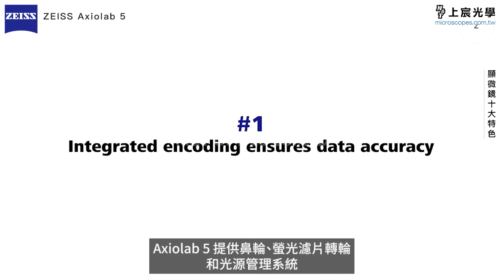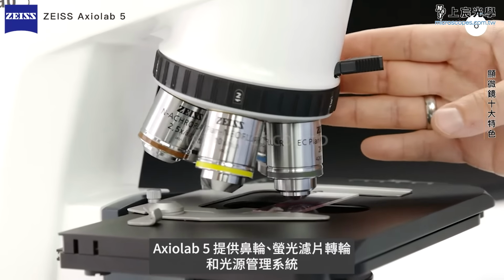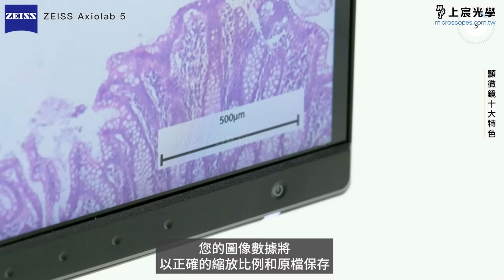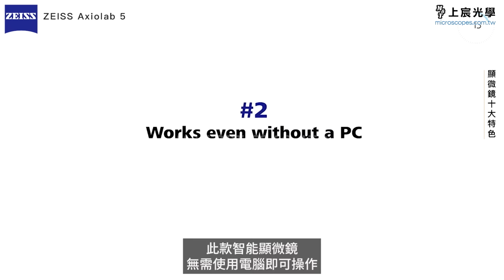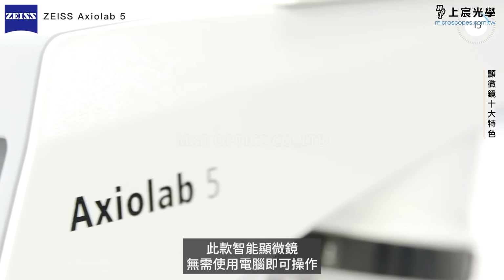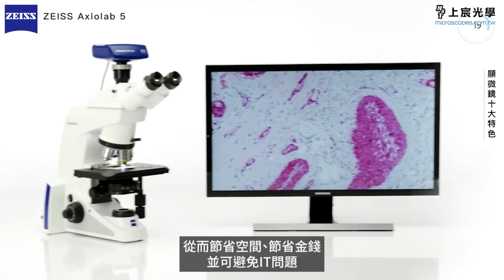Axiolab 5 offers integrated encoding of nosepiece, reflector turret, and LED light sources. Your image data is always saved with the correct scaling and metadata. This smart microscope system can be fully operated without a computer, which saves space, money, and prevents IT issues.